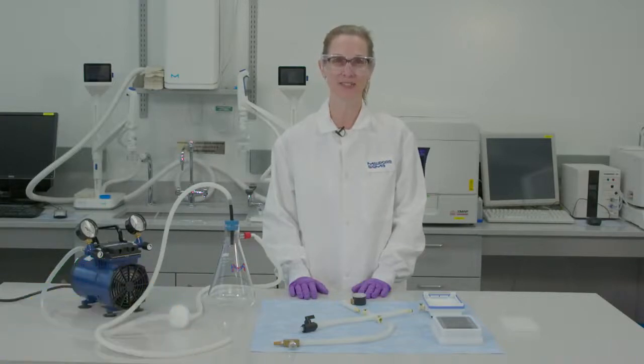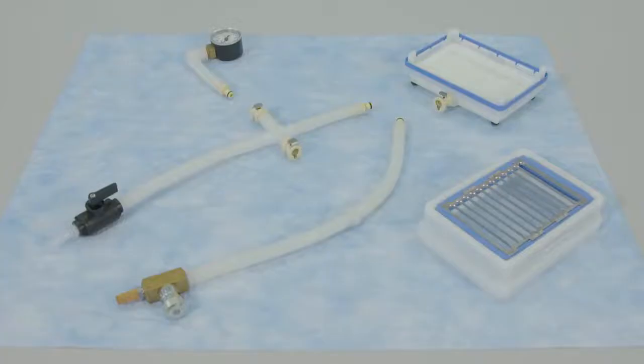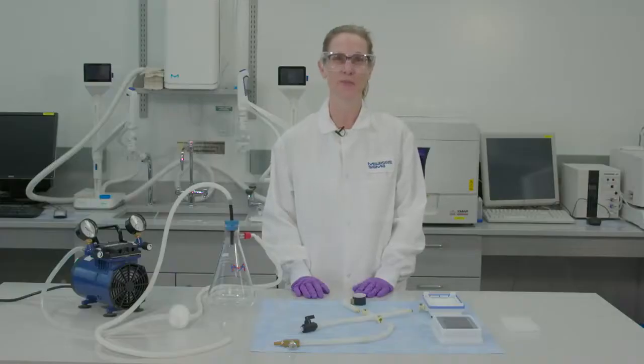Hi, I'm Maureen LeClercq from the technical service team and I'm here today to show you a frequently asked question that we get in tech service. How do I set up my multi-screen HTS vacuum manifold and test to ensure that the vacuum works properly?